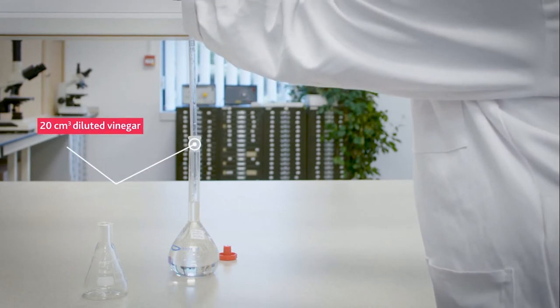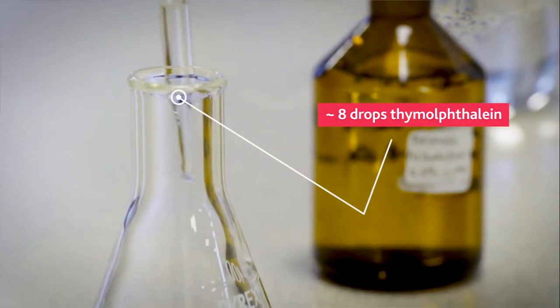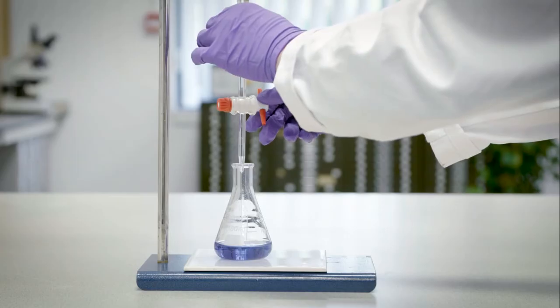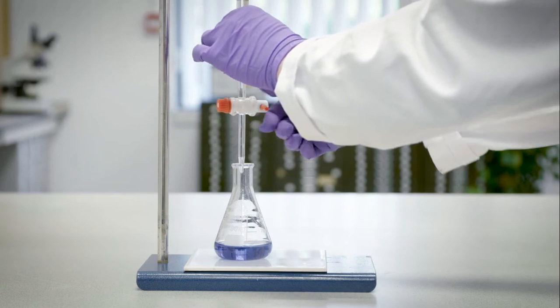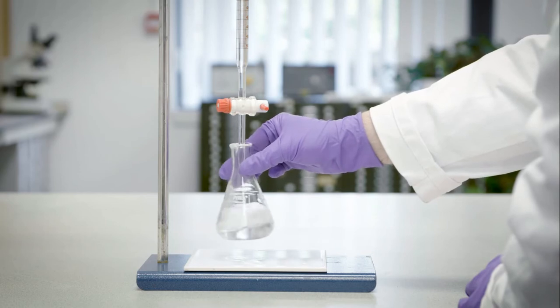The diluted vinegar sample is added to the clean conical flask using the pipette. Thymolphthalein indicator is added and the conical flask is placed underneath the burette. 17 centimetres cubed of sodium hydroxide is added to the flask and is gently swirled. The blue colour that is observed will disappear.